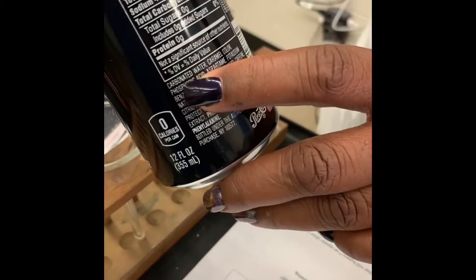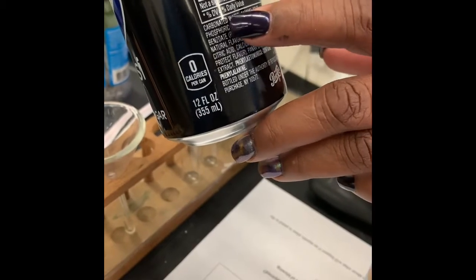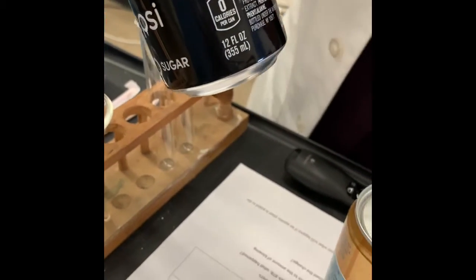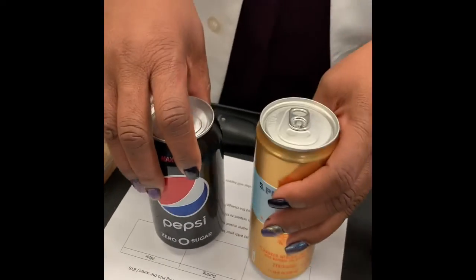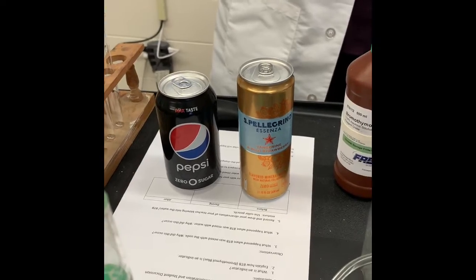This is a carbonated water, and we can tell here because it says flavored mineral water with natural CO2 added. So it has carbon dioxide in there. And let's see if it says anything about our sodas. Carbonated water. Okay, so carbonated water. So we know it has carbon in there. It has carbonic acid in there. Both of these do. And we're going to see if this pH indicator will really work.